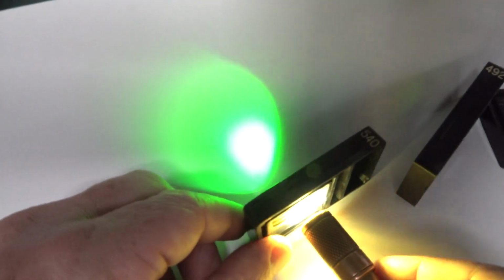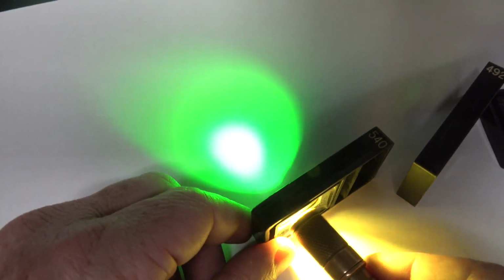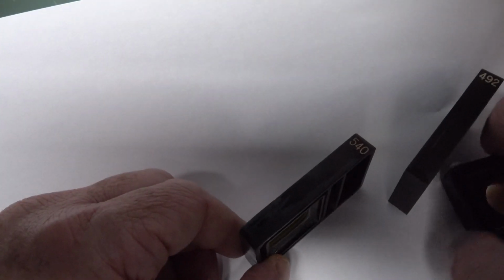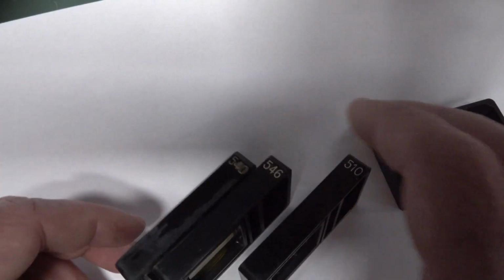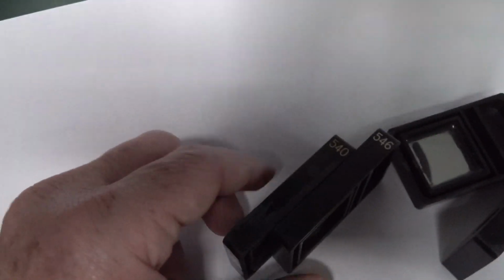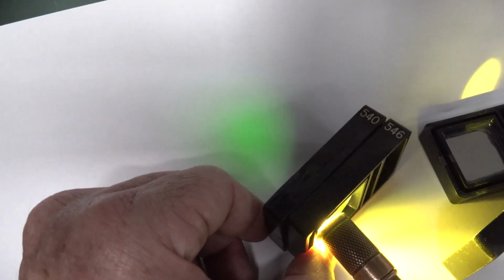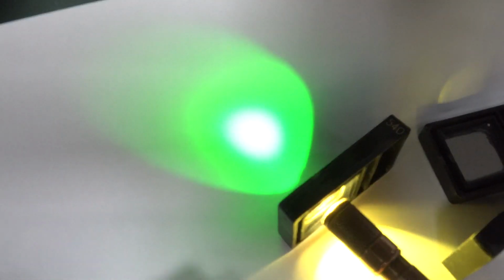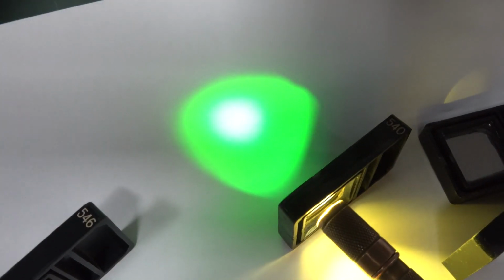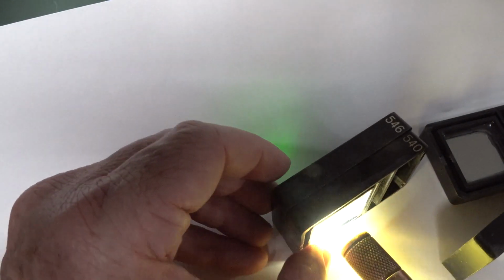Possibly. Let us know what your favorite color is and what your thoughts are on the bandwidth of these things. It's not as tight as I thought it might be with 540 and 546. It's not sharp because it gets through like that. It does attenuate it, of course, as you'd expect. Oh, that's beautiful. That's probably my favorite. I like 540. Whoa, beautiful.